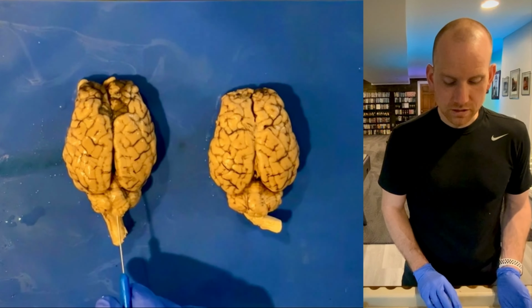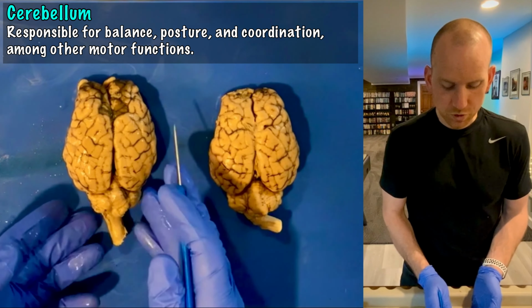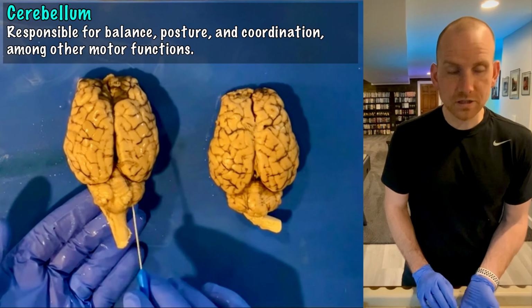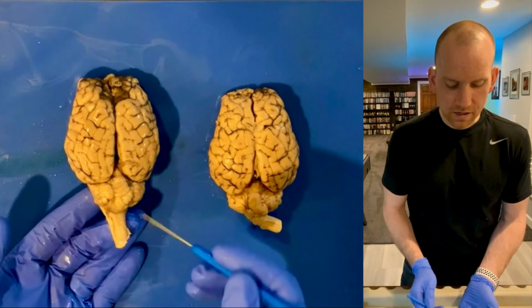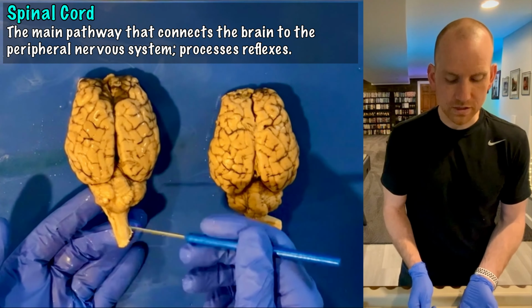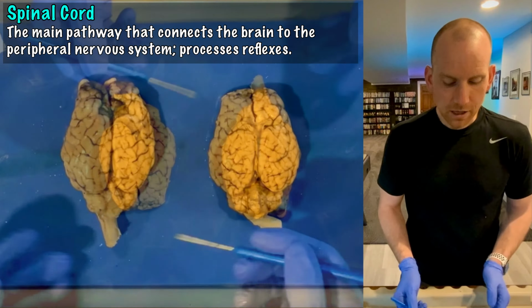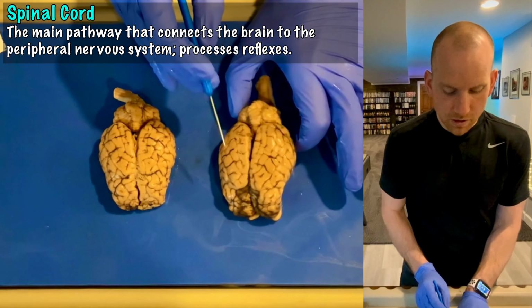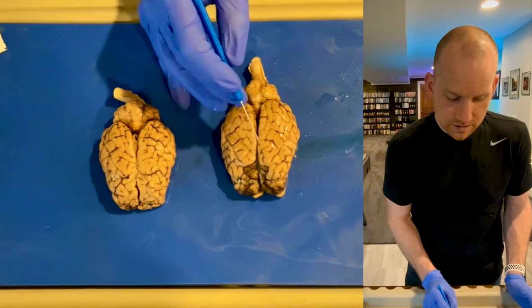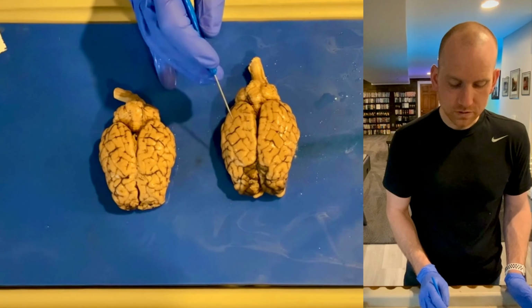And you can also see the cerebellum back here, which is there to control coordination, balance, and some muscle movement. And the spinal cord is just relaying information to the peripheral nervous system, right? It's sort of a go-between. But what I want to talk about are these hills and these valleys. So looking at the brain, you can see these things that kind of look like worms, right?